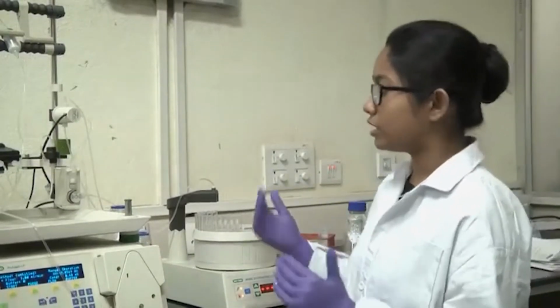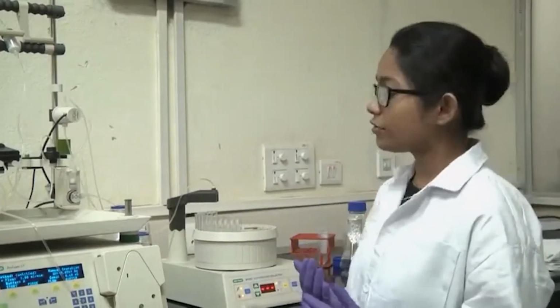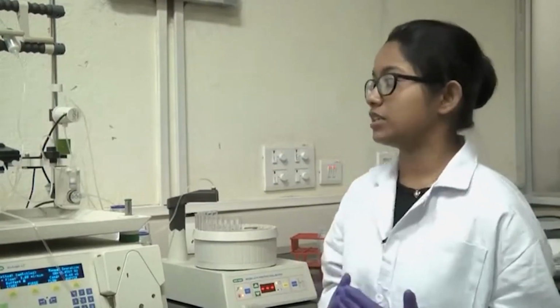So, now that you have run the wash buffer after your protein injection, basically your protein of interest will get attached to the column and other proteins will come out. Now, you have to run another buffer which will have another component. In the case of a nickel Ni-NTA column, it is imidazole. Imidazole has higher affinity towards the nickel beads, and it will attach itself to the nickel beads and displace your protein of interest which has the His tag, and now the His-tagged protein will come out as the eluent, and you have to collect those fractions.